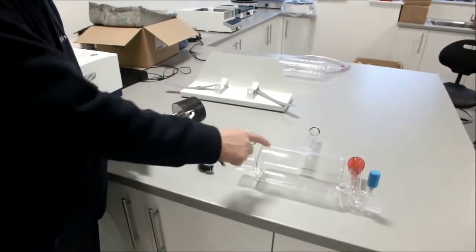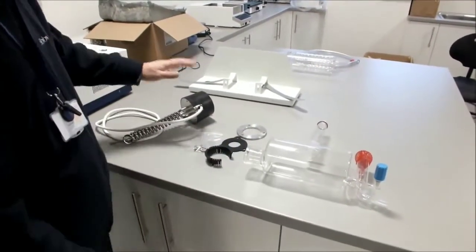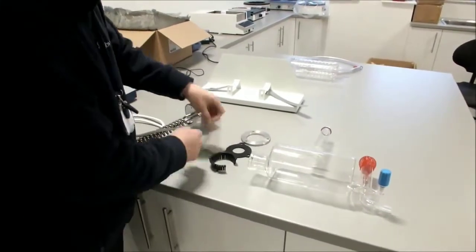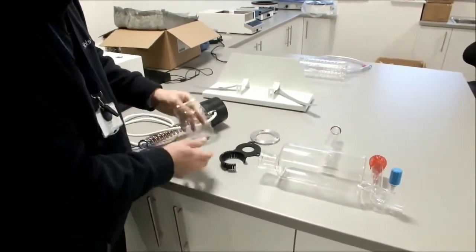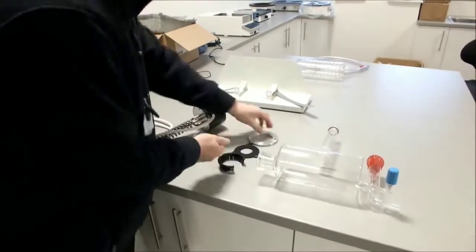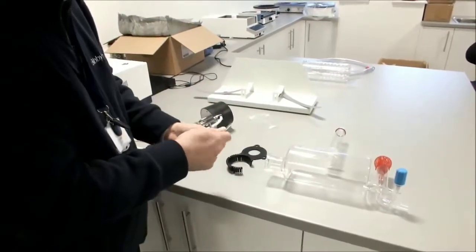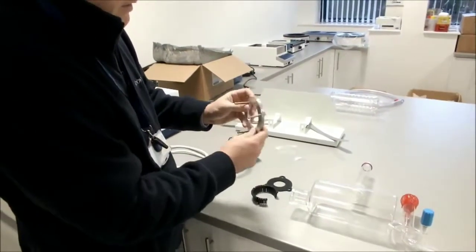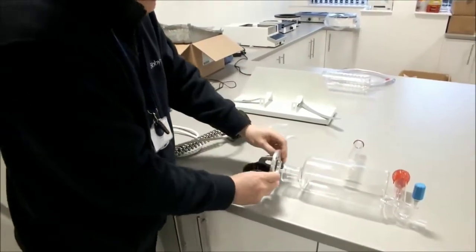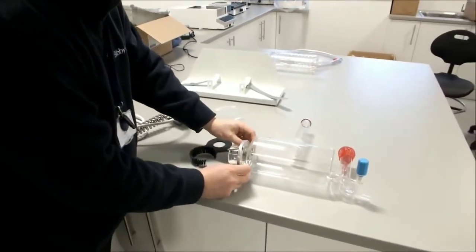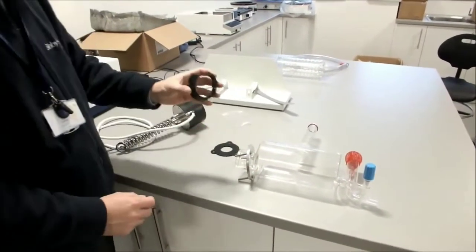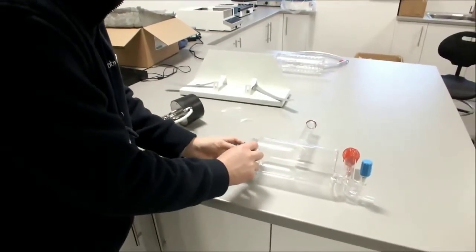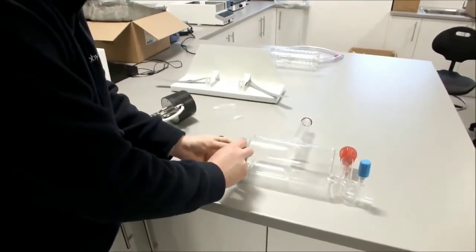First we will put our heater inside our boiler. To do this we use the heater, the gasket kit, and obviously the boiler. We take the three screws and place them inside the flange. The flange can be fitted either way. Then put the flange onto the boiler. Take the plastic insert, that fits around the boiler and fits inside the flange.